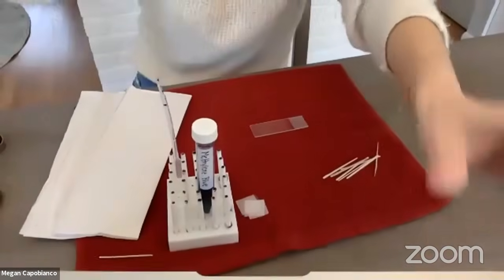Okay, and tap. All right. Now, keep in mind that our cells are going to be translucent, so we need to add some sort of dye, and this is methylene blue. I'm just going to dye my cells a bit and make certain structures stand out. So I'm just going to bring this down for a moment so you can see what I'm doing here.